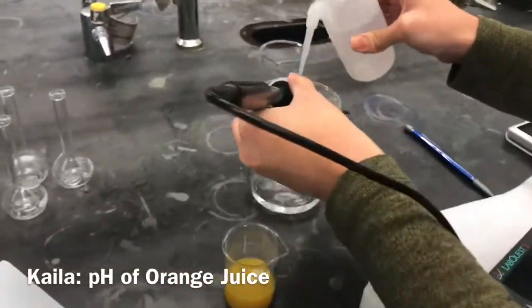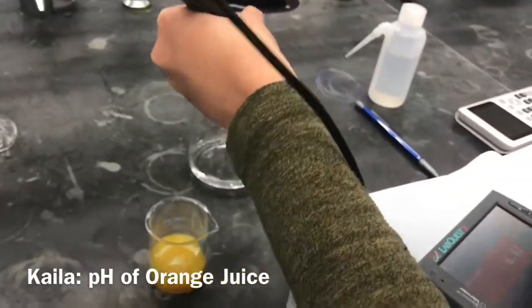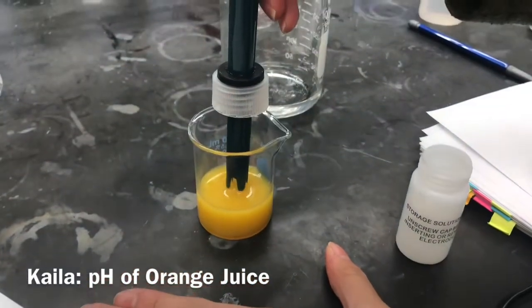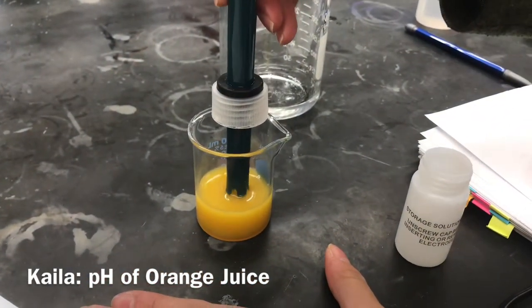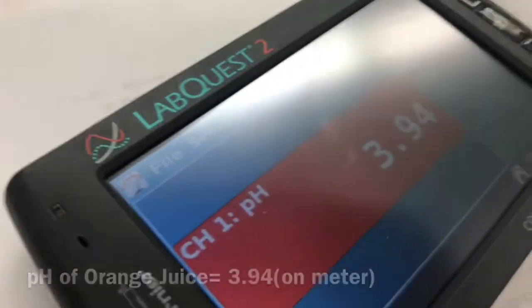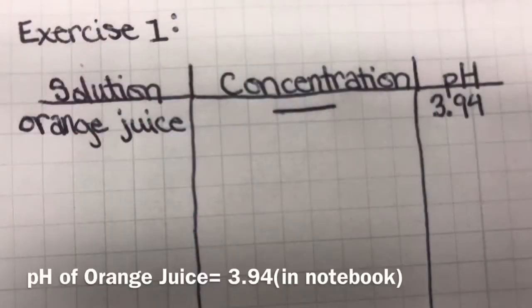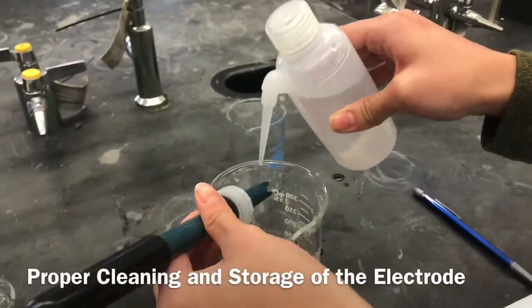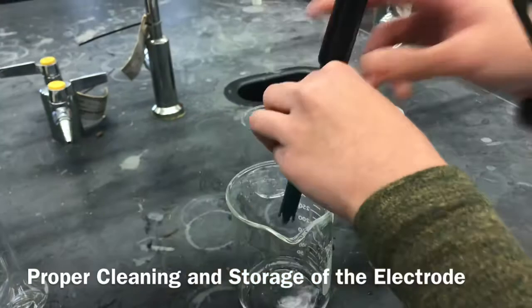Here we are using the pH meter to determine the pH of orange juice by rinsing the electrode and then immersing it in the orange juice. We wait for the pH to steady out and then record the value in our notebook. We then properly rinse and store the electrode for later use.